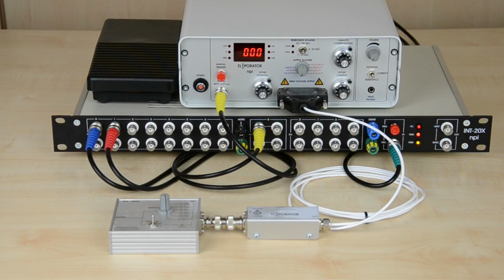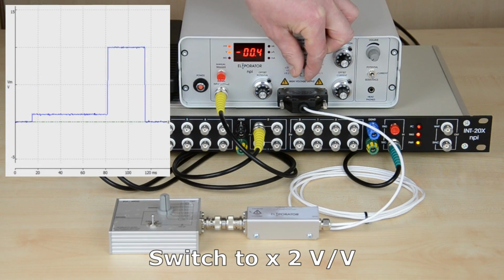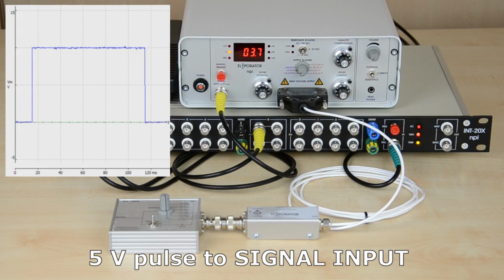The electroporator will not create an output signal by itself. It will translate input signals into high voltage output signals according to the selected scaling. Switch to 2 volt per volt. A 5 volt square pulse at the signal input will be translated into a 10 volt square pulse at the output.